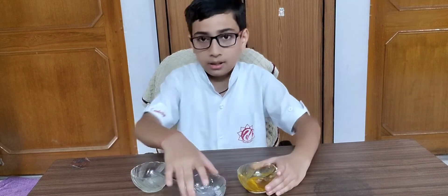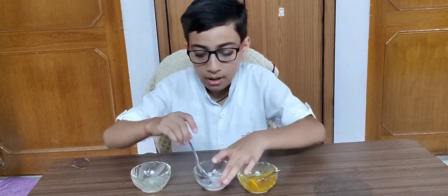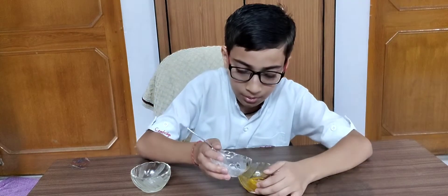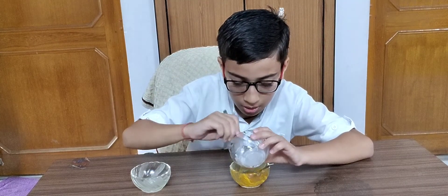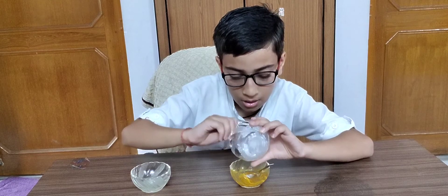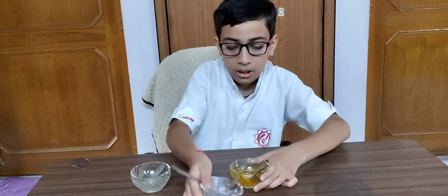Now we are going to start this activity. This indicator will show that this is basic and this is acidic. Turmeric indicator changes its color when added to a basic substance. Now we will put the basic substance into the turmeric.